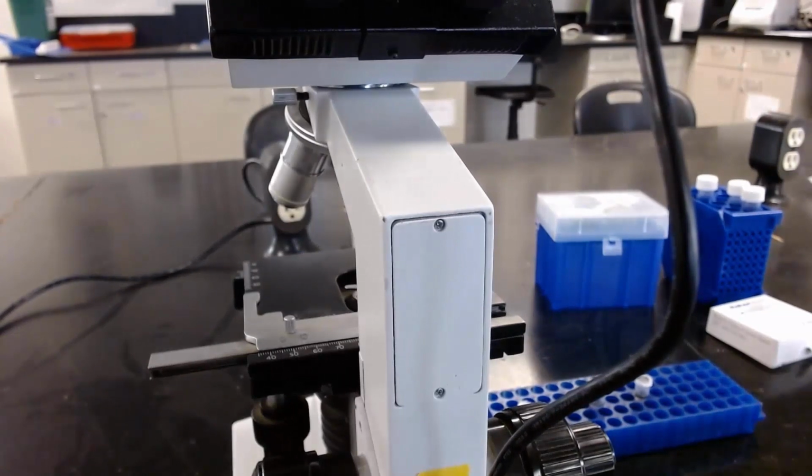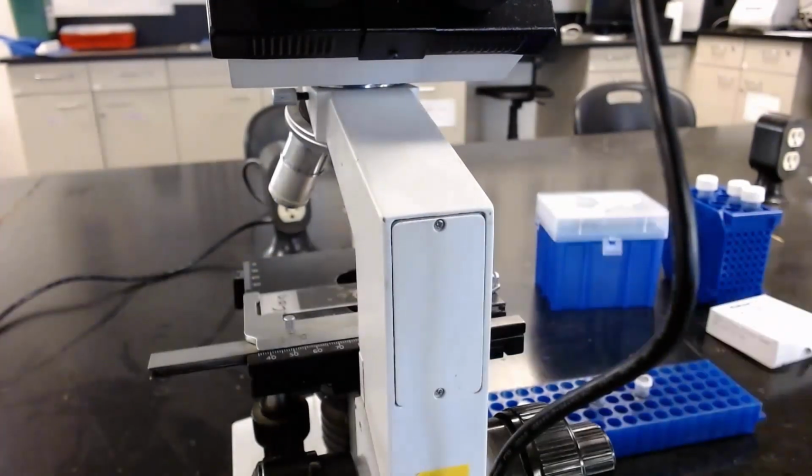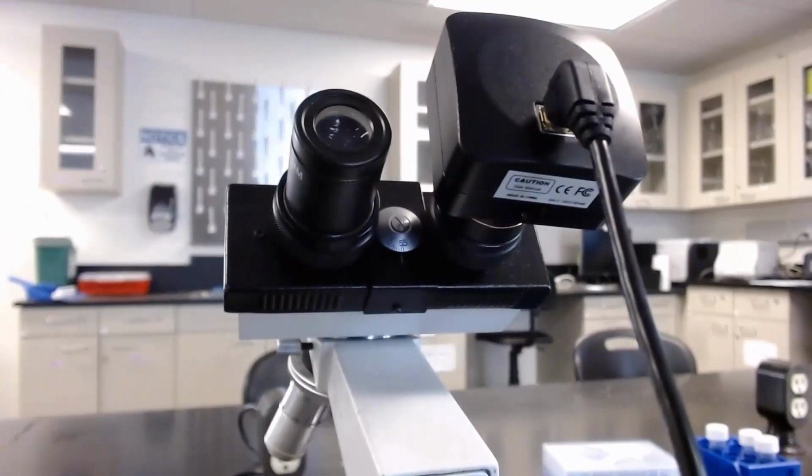So now let's mount the slide with the glutaraldehyde on the microscope and find our tetrahymena with this nice microscope camera. Here's what it sees at first. We're on the lowest magnification, 40x, and can't see anything yet since we're not in focus. I'll start by adjusting the coarse focus, which will take a bit of time. These annoying lines will go away on higher magnifications.